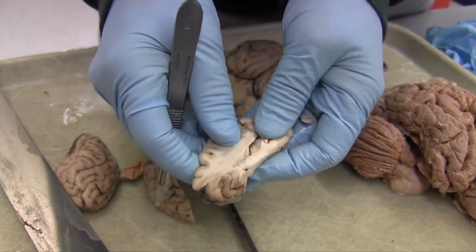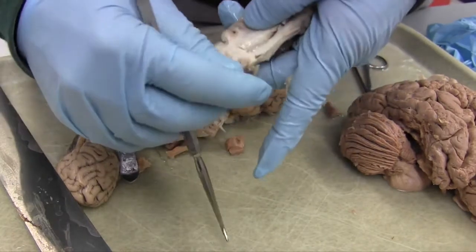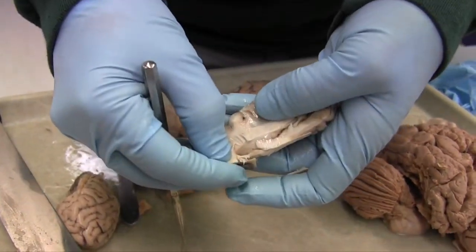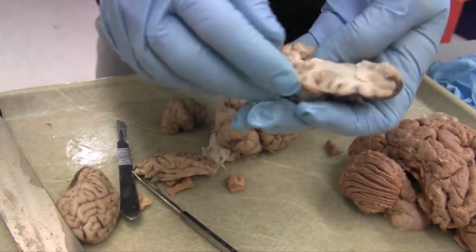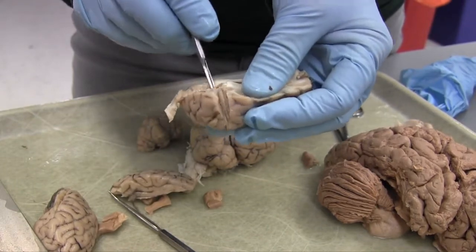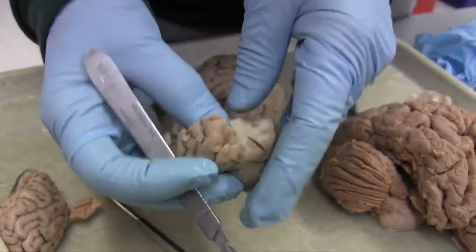Okay, so there you go. We're going back to the back end, and we're going to come up here. It's not a great dissection, but we're coming up there. There's the front end. But the most fun part is to try and get it into the temporal lobe, so that we can see a nice hippocampus, we can see the nice C shape, and there it is. So there, look, I just went in, and there it is, and I can follow it.